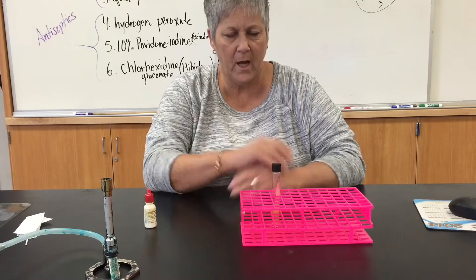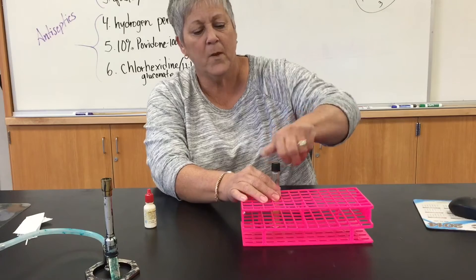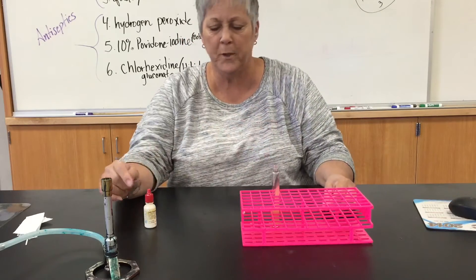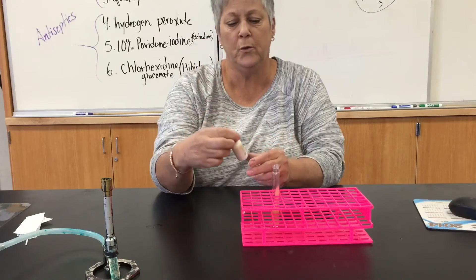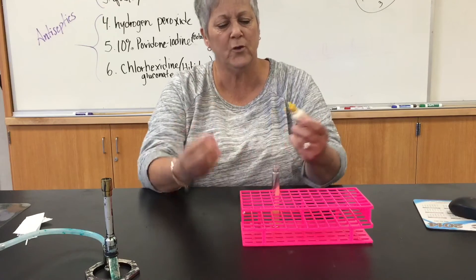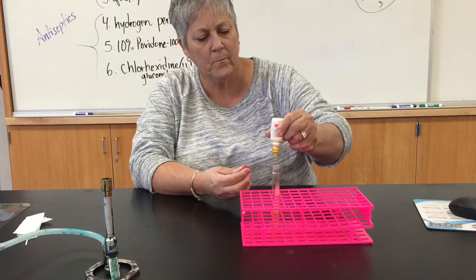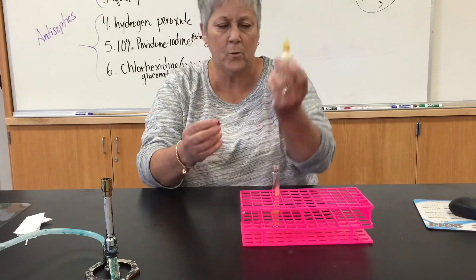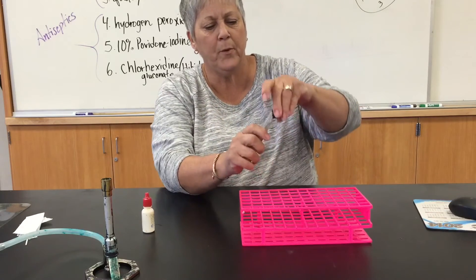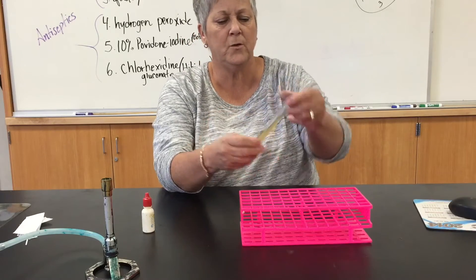After incubation, gloves on, but I don't have any microorganism here. I'm not so much worried about sterile at this point because these tubes will be disposed of when we're done. You will use a reagent called ferric chloride, and what you will do to finish up the test is add five drops. Don't touch the bottle to the tube. Replace the cap of the tube on your organism.